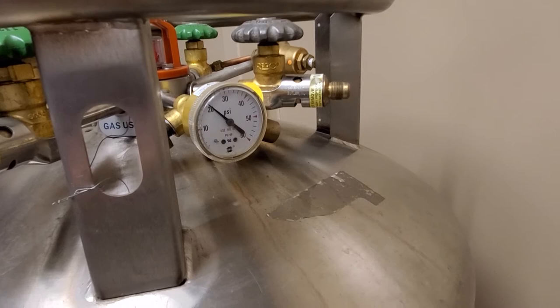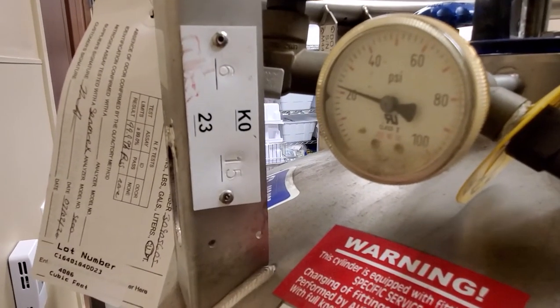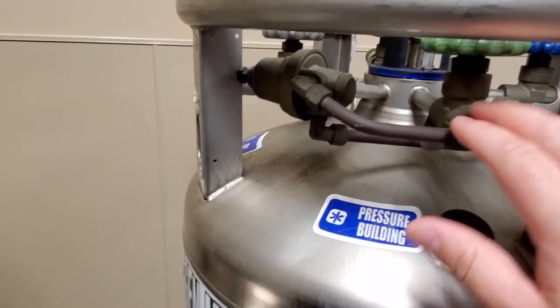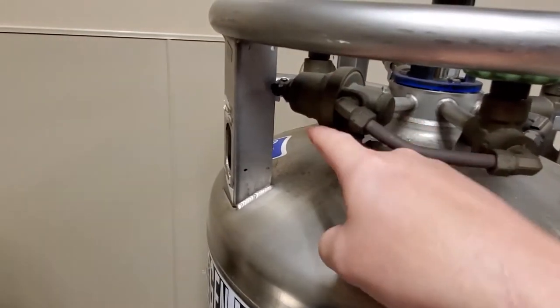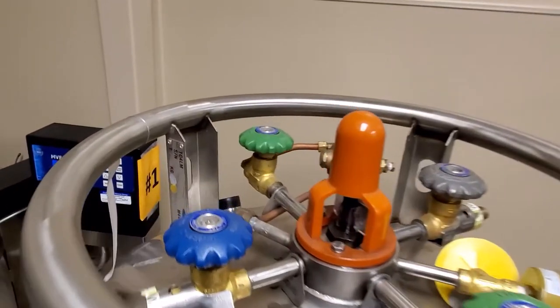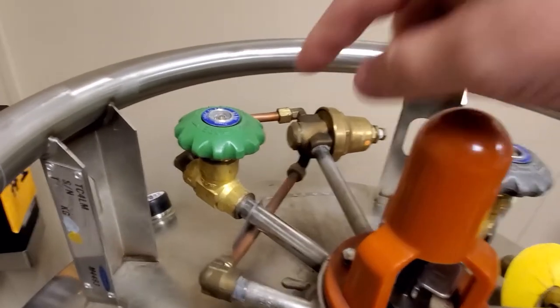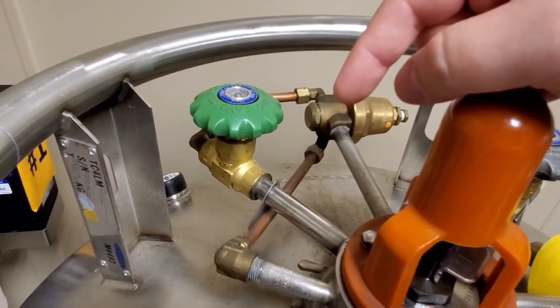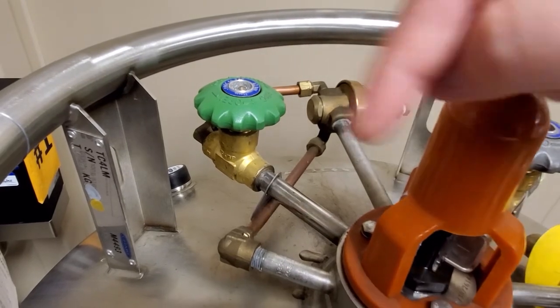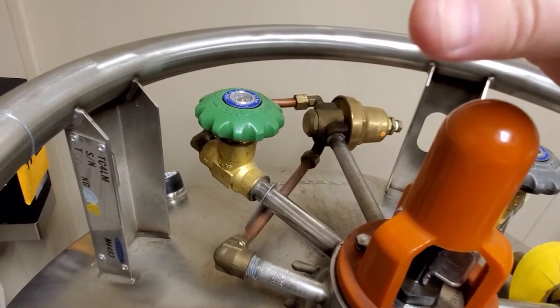This tank is at about 20 psi, and this tank here is also about 20 psi. On these tanks you will see a closed circuit — it comes out of the center, goes over to a regulator, and goes back into the center. It has a green knob. What this does is build pressure inside the tank by circulating some of the liquid nitrogen and spraying it inside the tank, which makes it expand. That expansion is what gives you tank pressure.